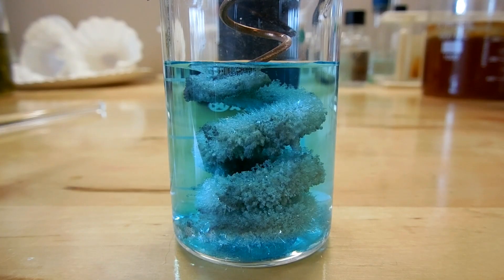Now at this point the crystals start to look a little gross. I think this is because it initially grows really nice small single crystals, but then those start branching out more and more like little snowflakes. And the more tiny crystals you have, they absorb light a little better, so it'll look blacker and blacker. So the crystal tree now might look a little less pretty, but it is still all silver metal.